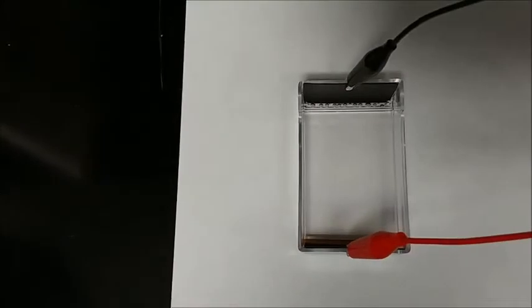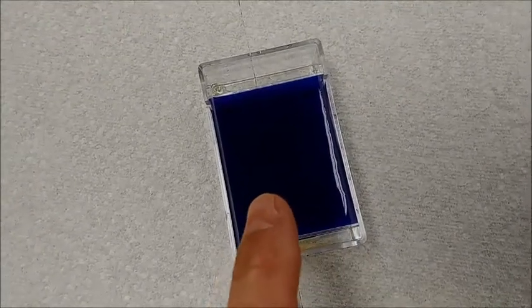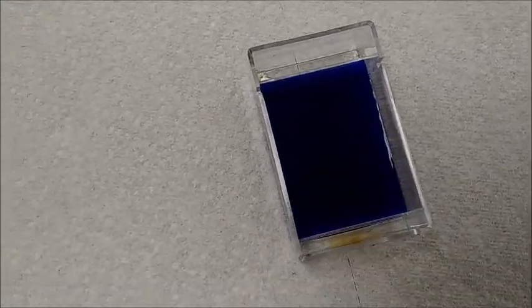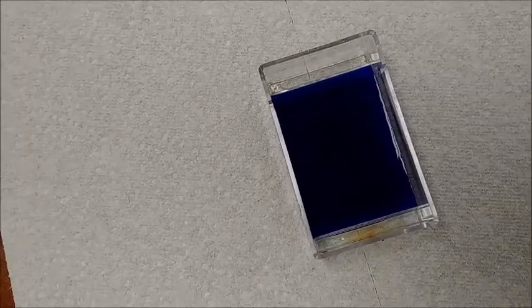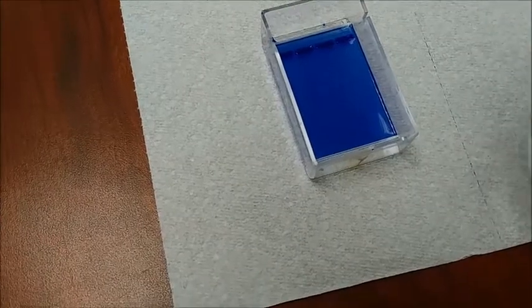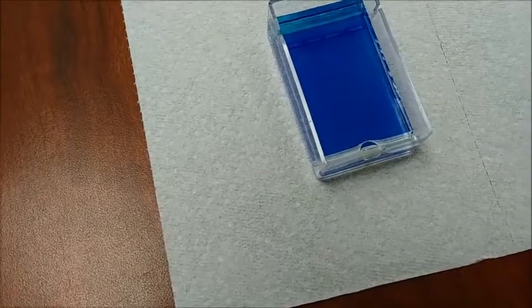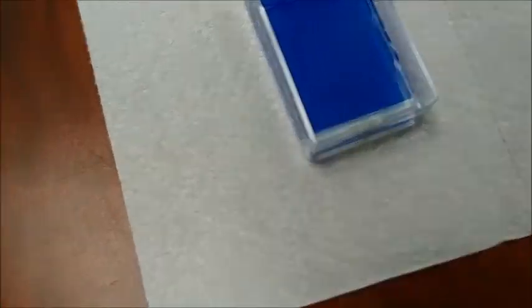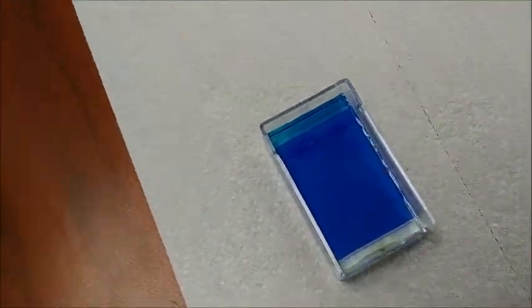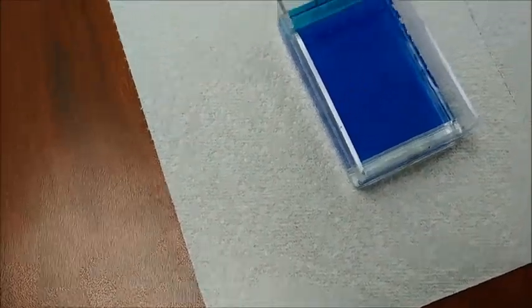I think it's running a little bit quicker than I originally thought. I just added the blue final stain. It's going to stay for three or four minutes. I'm going to dump that off, and then I will start rinsing, and we'll see if we see any DNA banding. I poured off the original blue stain, and now I'm going to rinse consecutively, and then I'm going to put it in a plastic baggie overnight and let it develop, and then rinse it again tomorrow. We'll see what happens.